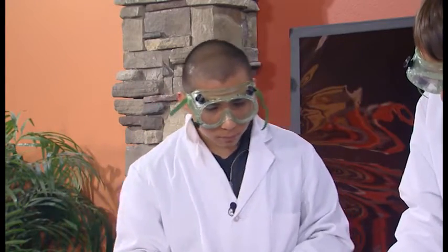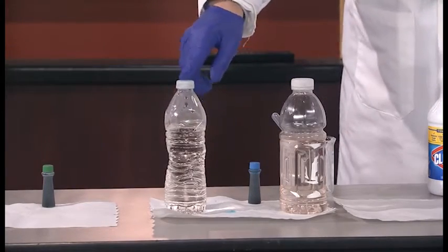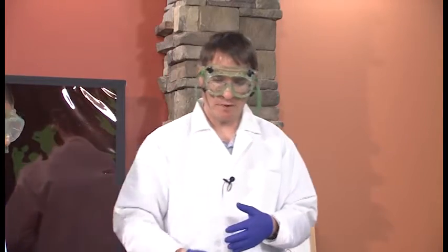Interesting. So it's been a few minutes, and I think our initial observations were actually wrong. The hot temperature solution is definitively colorless at this point, whereas there's still at least a little bit of color left in the room temperature water. So your prediction was true. The experiment worked exactly as we hoped it would. Yes. And we saw that at higher temperatures, the reaction is much faster than it would be at lower temperatures.